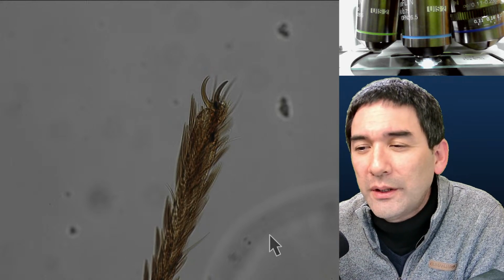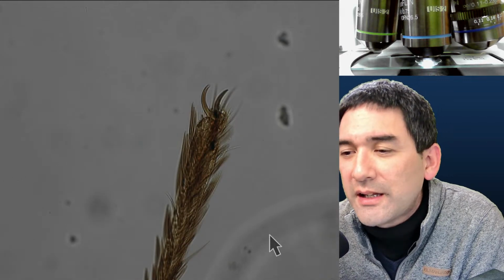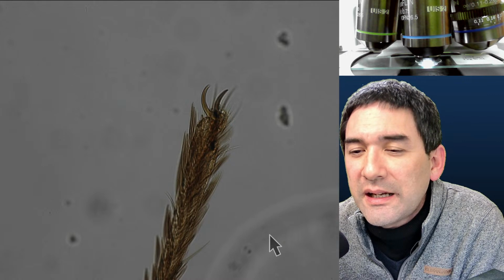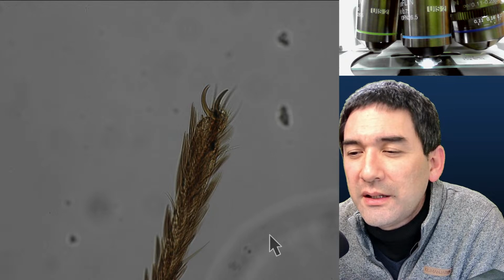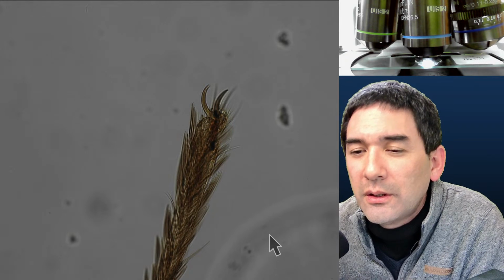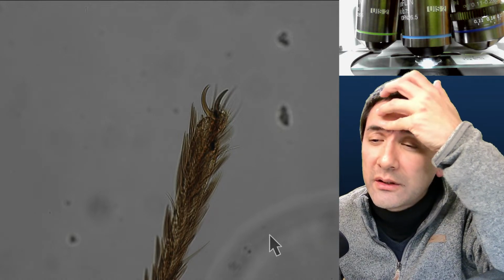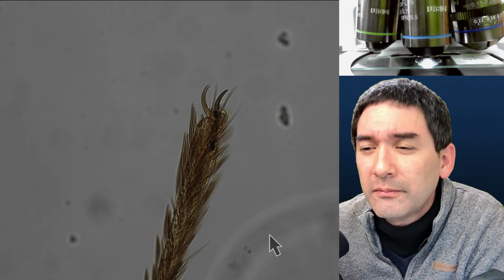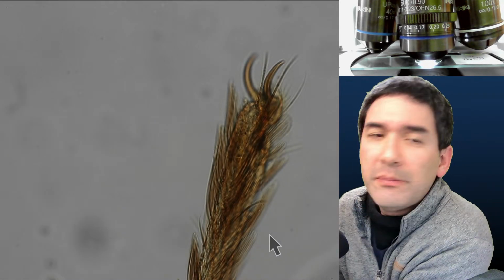I cannot read this now, unfortunately, because there's this thing covering it. I would love one day to see an insect leg damaged by diatom earth. Will we see the scratch? You mean diatomaceous earth? I do have diatomaceous earth at home. So, interesting. Basically the diatomaceous earth being in contact with the insect, you mean.